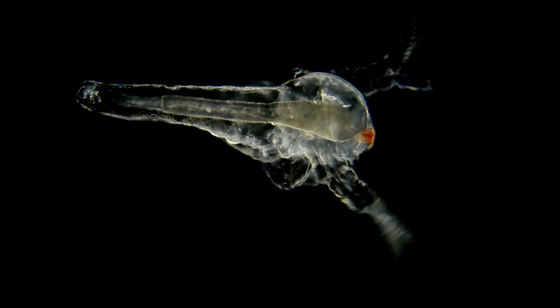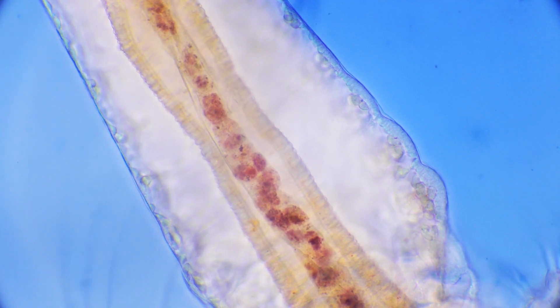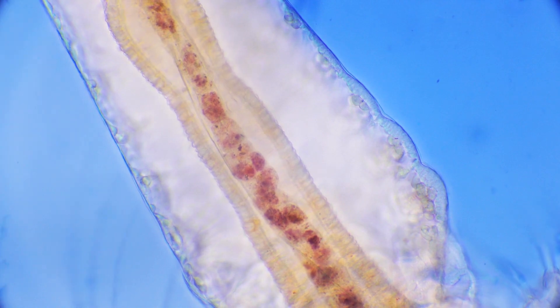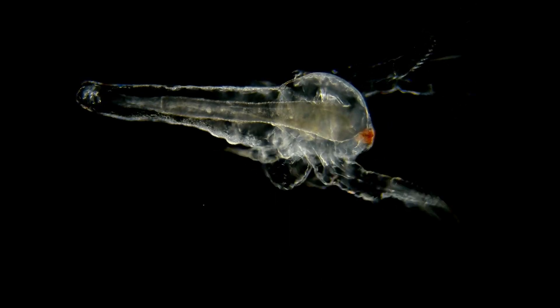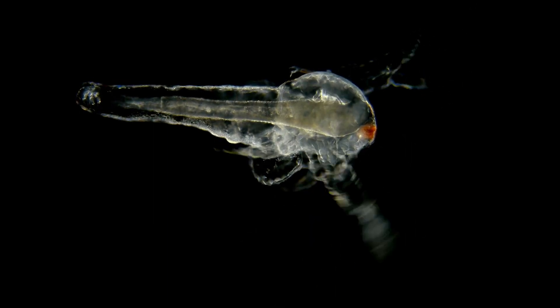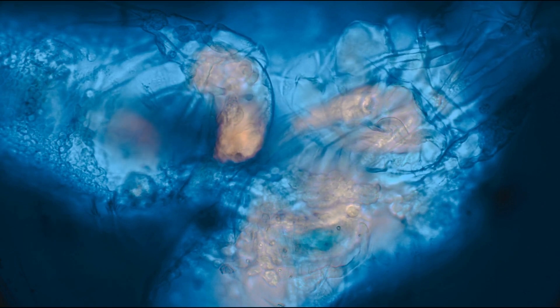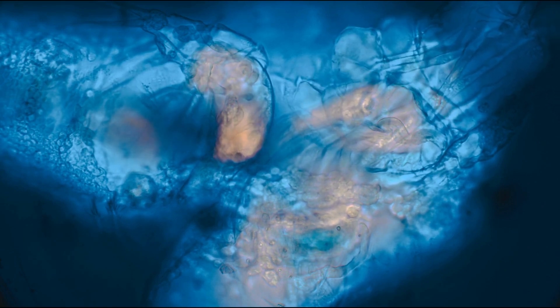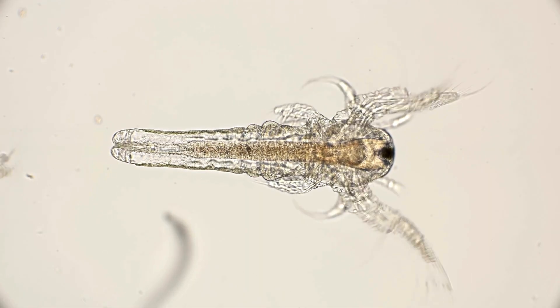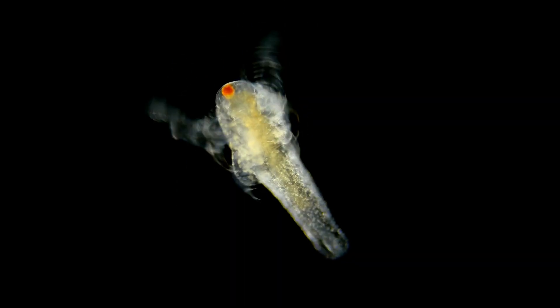The Brine Shrimp Lethality Test is a common method used to evaluate toxicity in shrimp. In this test, a sample of a compound being tested is added to a solution containing Brine Shrimp larvae. The number of surviving larvae is then counted after a specific period. If the compound is toxic, it will kill a significant number of larvae, indicating potential toxicity in humans.